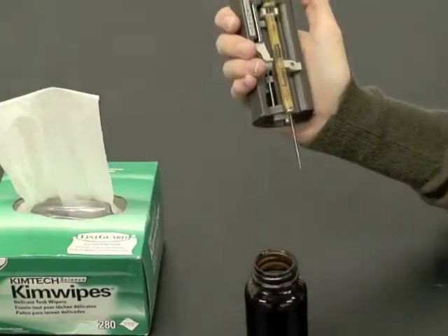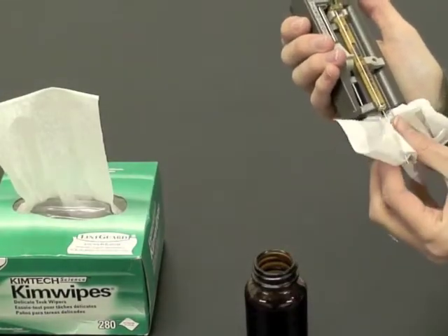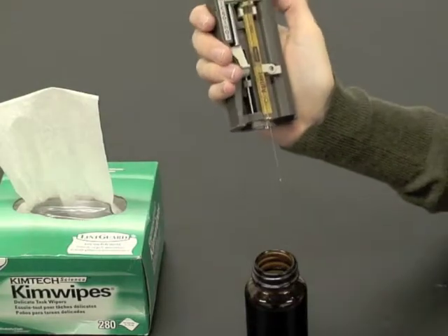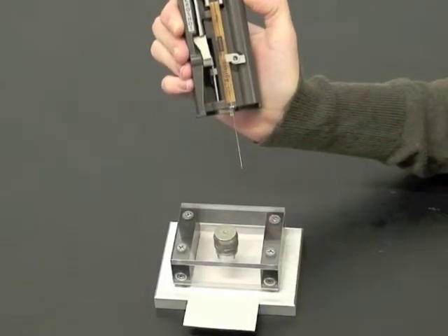Wipe the needle. I have a demonstration injection port here.